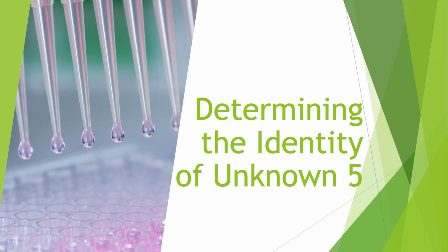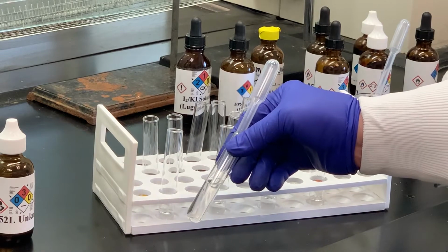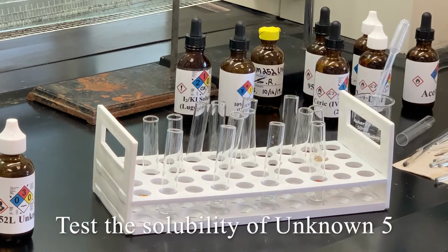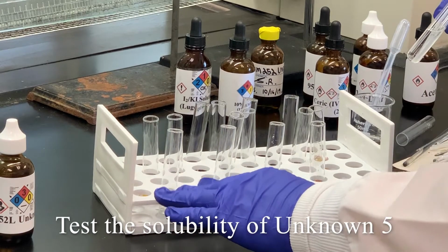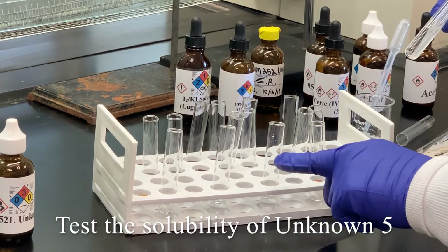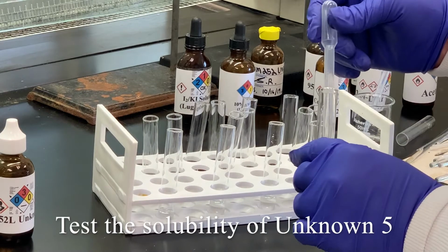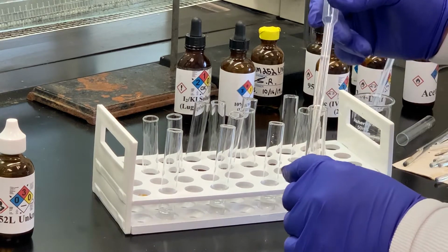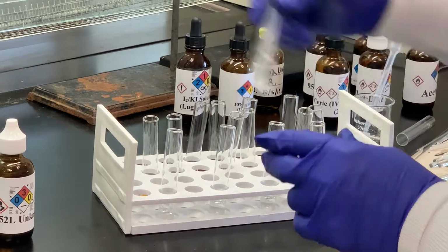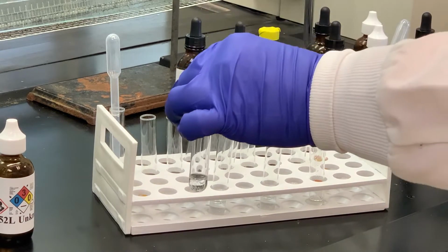Our last unknown is unknown number 5, and you can make a record of what the substance looks like. What I have here in these test tubes is water. We're going to do solubility tests: water, sodium hydroxide, hydrochloric acid, and sulfuric acid if we need. So we'll add a few drops of our unknown to the water. See what happens there.